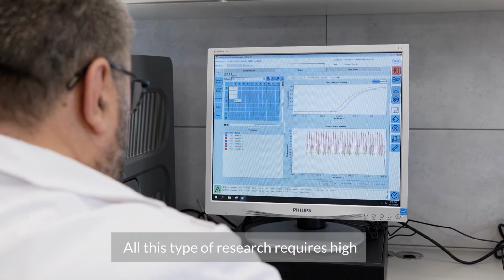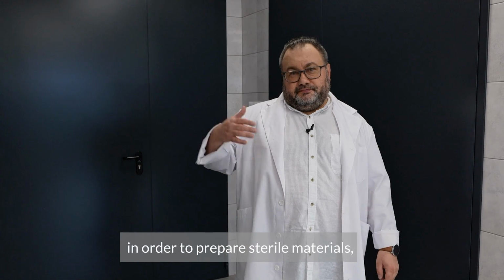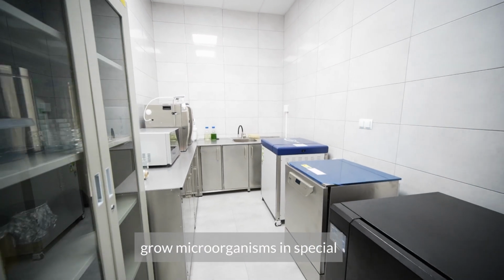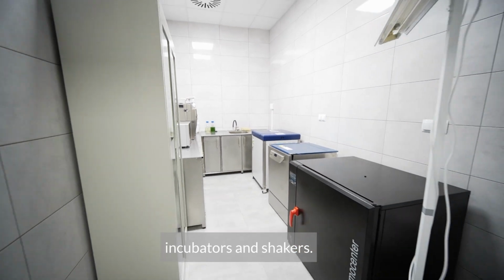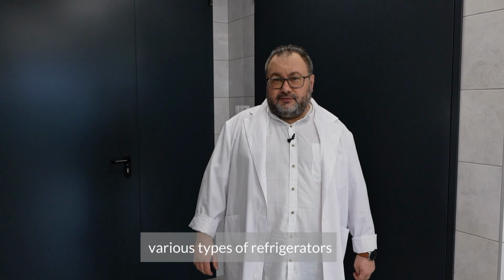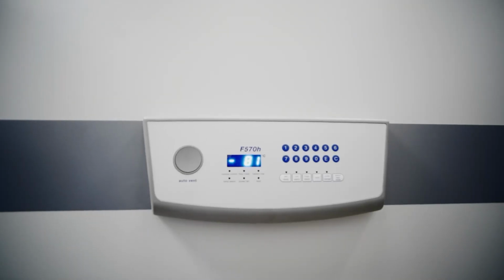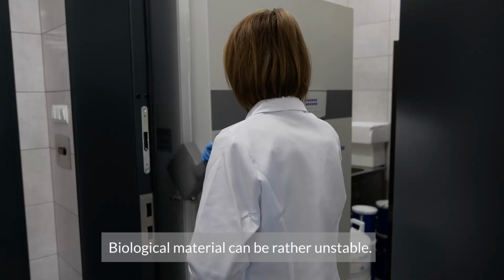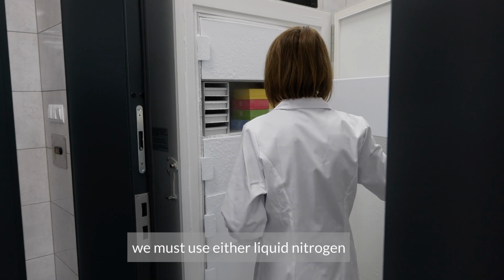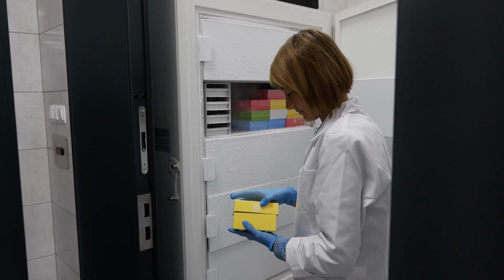This type of research requires high-quality facilities. We need certain conditions in order to prepare sterile materials to make the planting media, grow microorganisms in special incubators and shakers. We also need a facility where various types of refrigerators may be used to store the material. Biological material can be rather unstable. In order to preserve this material, we must use either liquid nitrogen or low-temperature freezers.